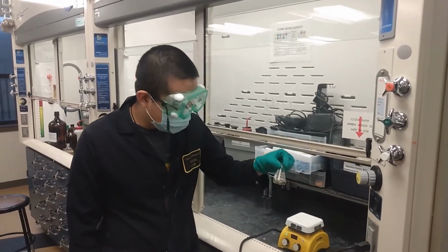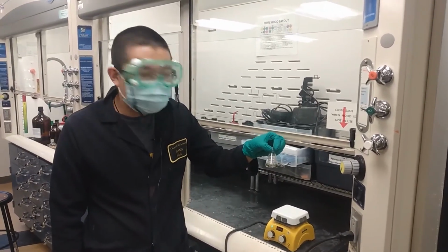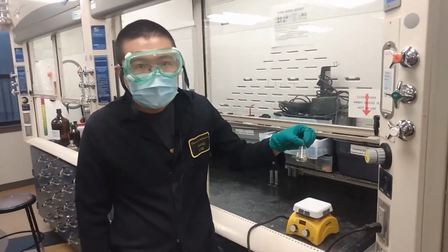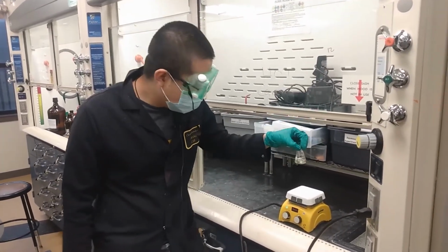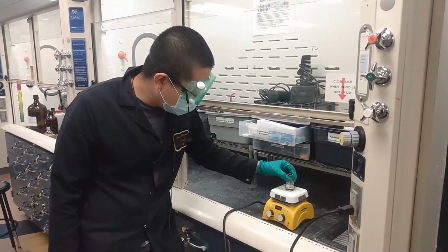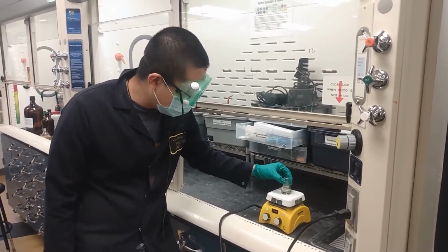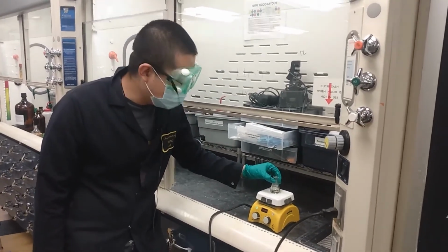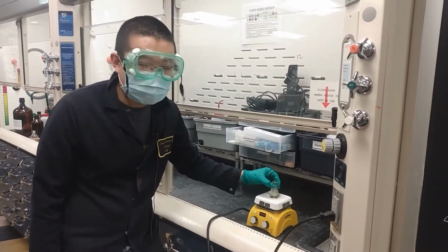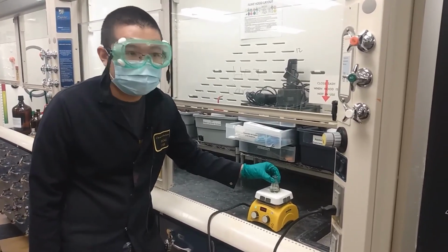So after we remove all the solvent in the round bottom flask, we use a few milliliters of DCM to dissolve and transfer all the product into a small Erlenmeyer flask, and then we use a hot plate to gently heat it to boiling, and let the total volume be approximately 8 to 10 milliliters, and then we let it cool down to room temperature. Then we further put it in the ice bath, let the product recrystallize in the Erlenmeyer flask.